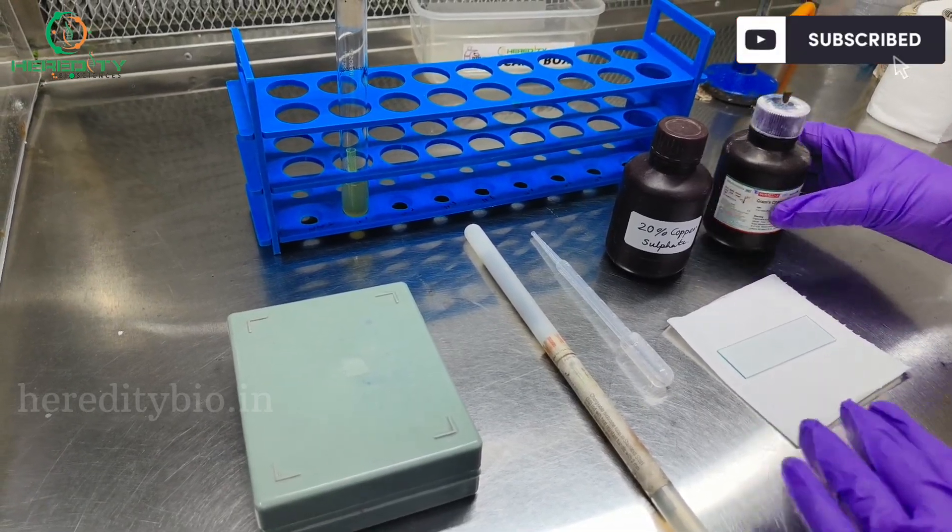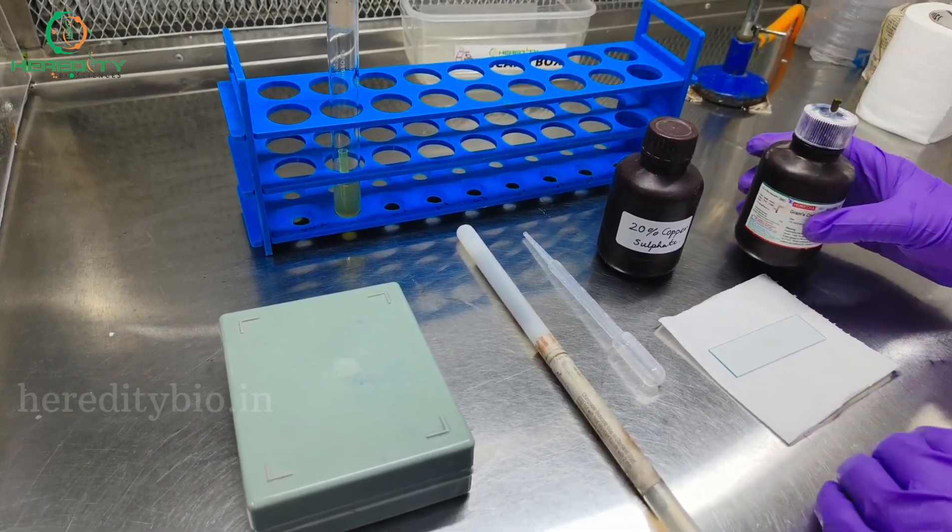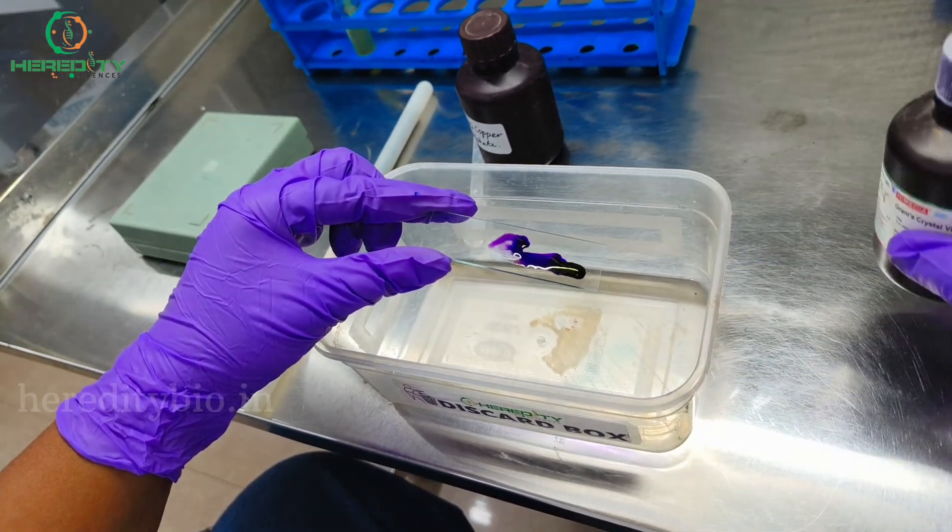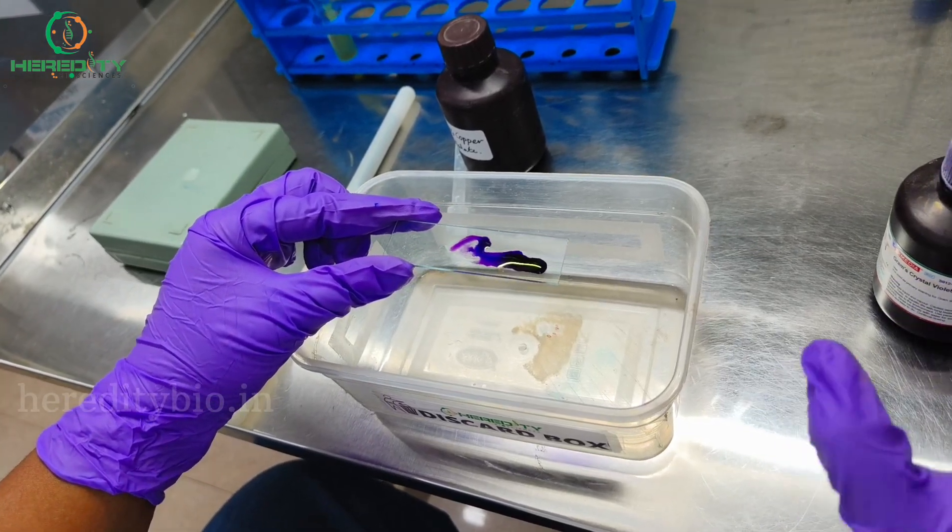First, we will add Gram's crystal violet and leave it for one to two minutes.